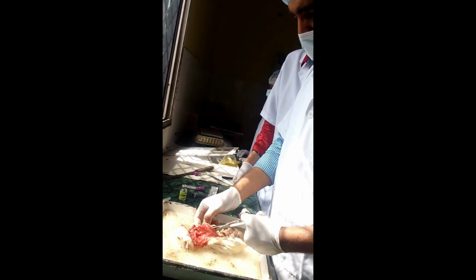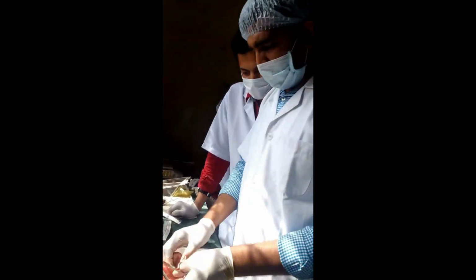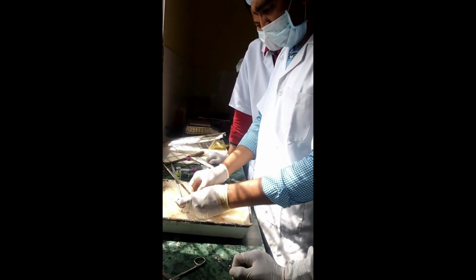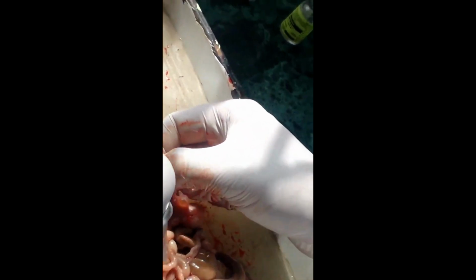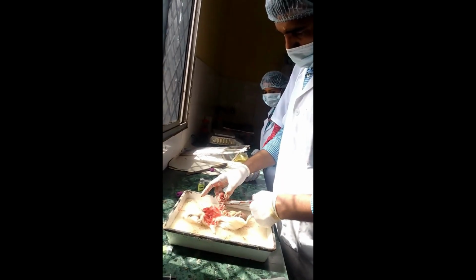Here you can see the blood is already spread and other organs are not visible properly to remove. So while you are removing the liver, you have to focus on wiping the blood properly, otherwise you have to face such a situation. Finally, you can see here we have removed the liver.